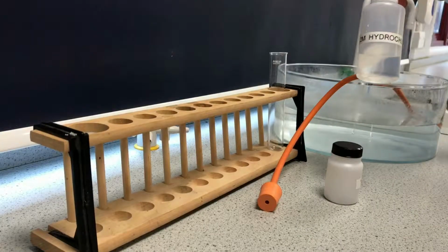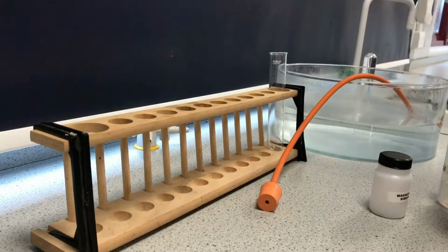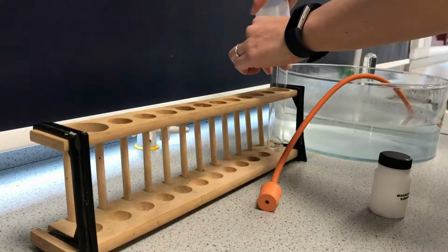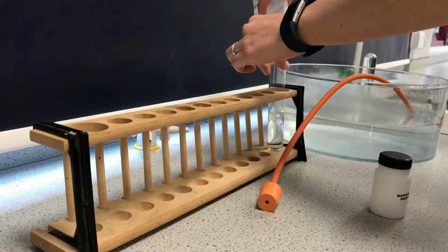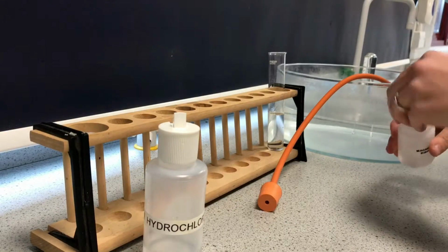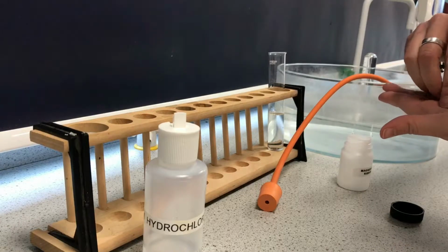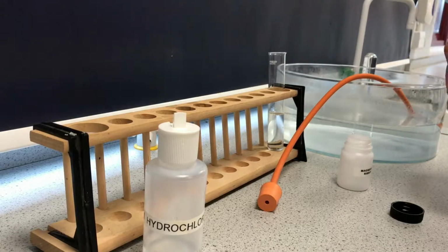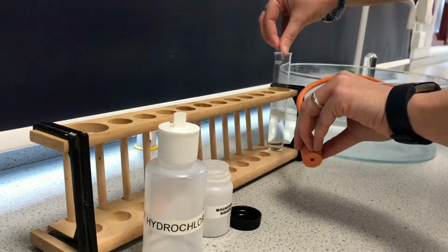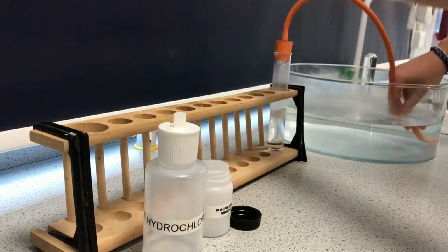So I have some 2 molar hydrochloric acid and I have some magnesium ribbon, and I'm going to put them together in this boiling tube. I don't want to overfill it, so I want to have enough of a reaction but not allow the reaction to go over the top of the boiling tube. I've got quite a few pieces here, maybe 5 pieces of magnesium ribbon. So I'm going to put those into my acid, immediately fizzing, releasing lots and lots of heat because it's an exothermic reaction. We'll talk more about that later.